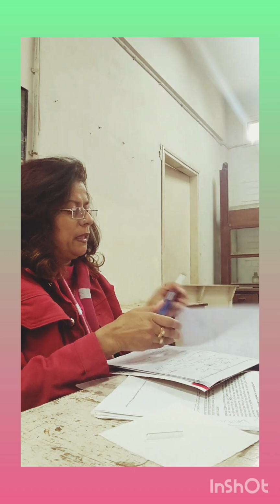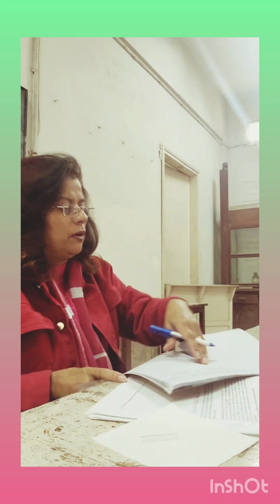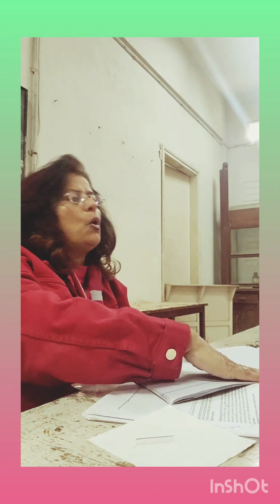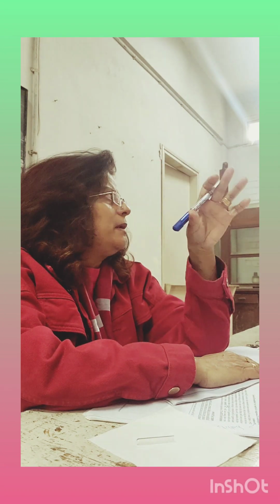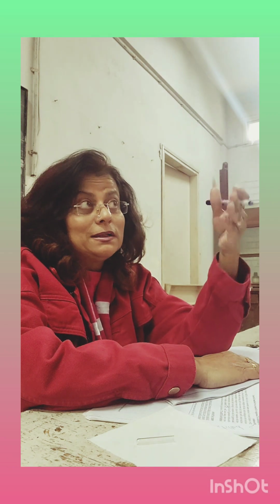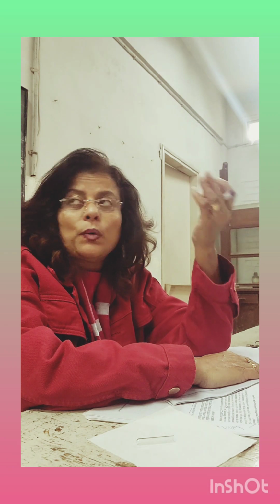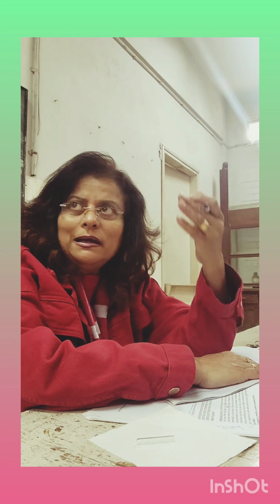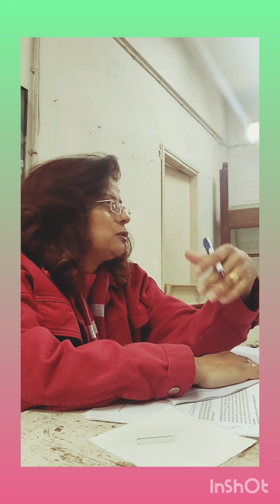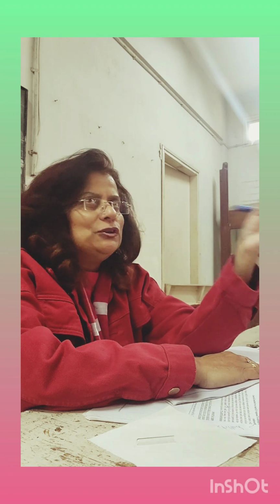Because you need to know how to start the experimental process, how to write down in the journal, or in your logbooks. In the labs we call a book where we input our data a logbook. Whatever results you are getting, we call it data. This is all the data you are collecting. So we call it a logbook or a journal.